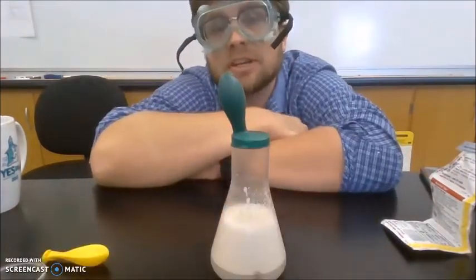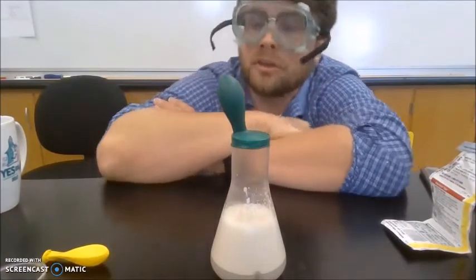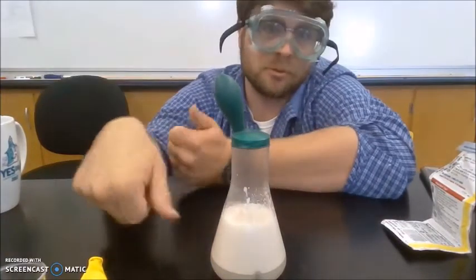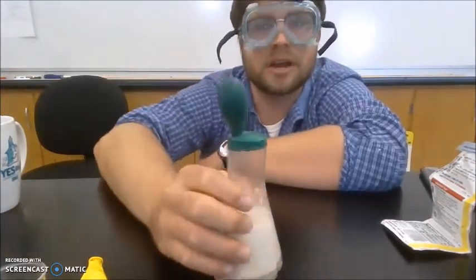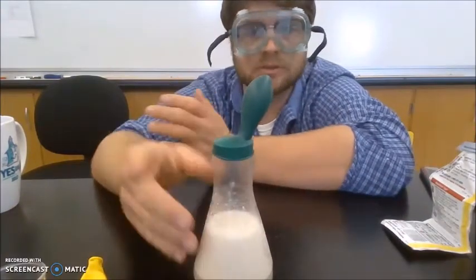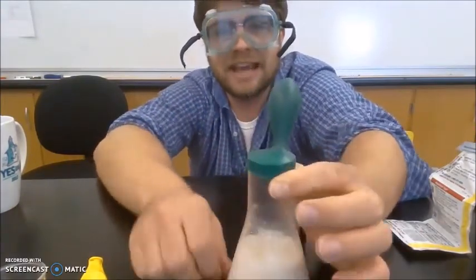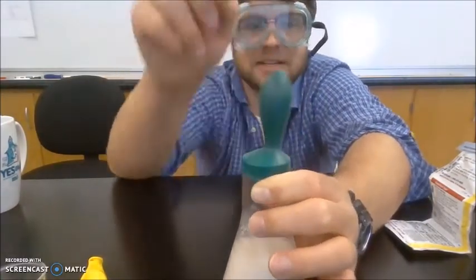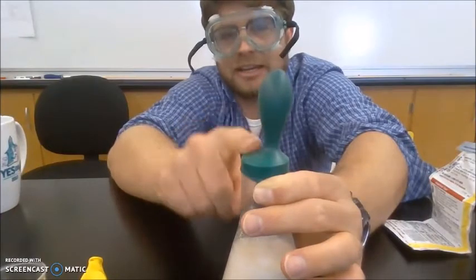I just experienced some experimental error, human error on my part. The balloon popped off and then I ripped it while I tried to put it back on. So now I have a green balloon. And in a matter of a minute, it has reinflated itself. And you can see as we speak, this balloon may be a bad balloon to use because it looks like it's inflating right here.